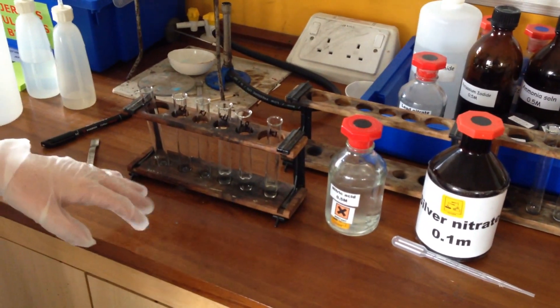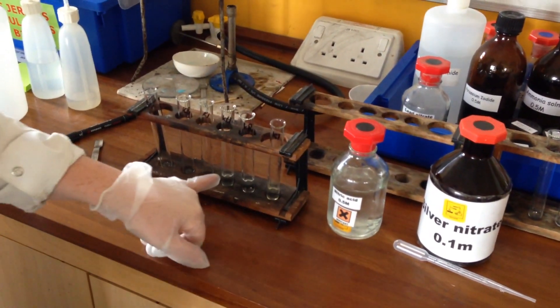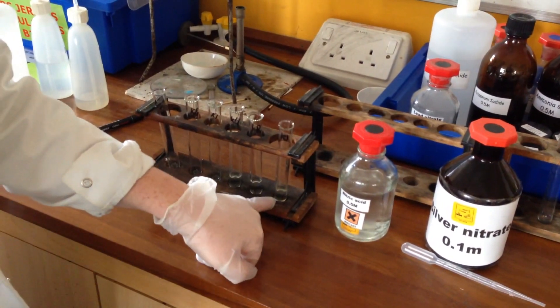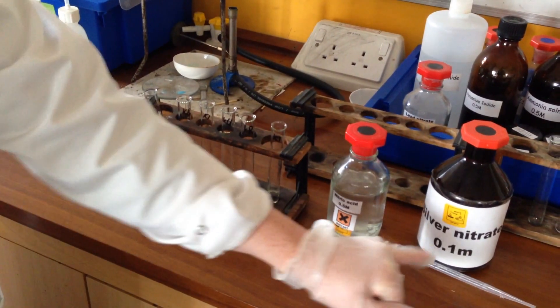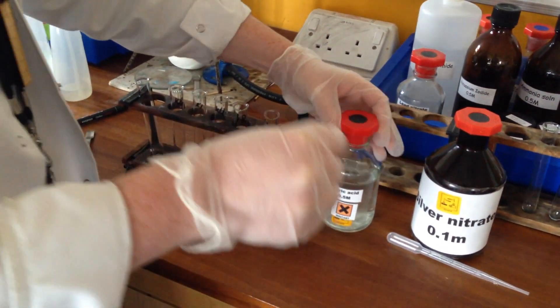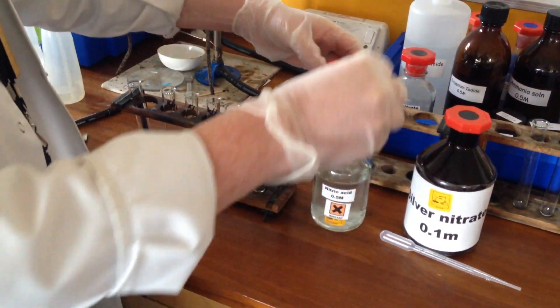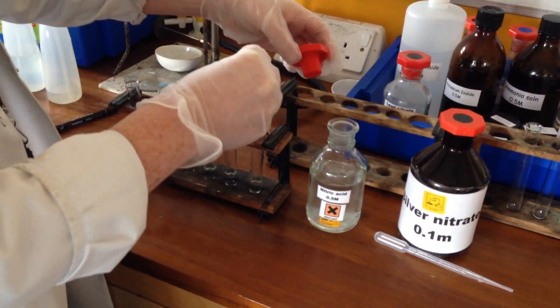We're going to be testing for the halide ions here. We have potassium chloride, potassium bromide, and potassium iodide. I'm going to add nitric acid and then silver nitrate. So first of all, just an equal volume of nitric acid to each one.